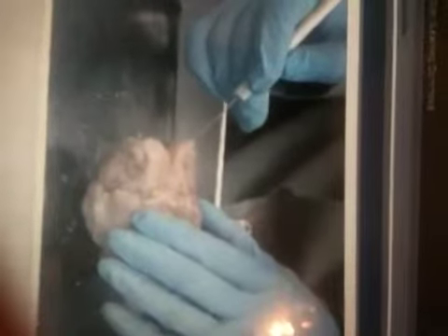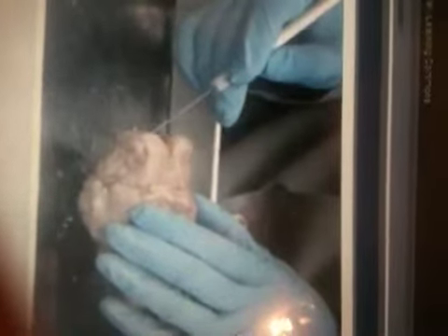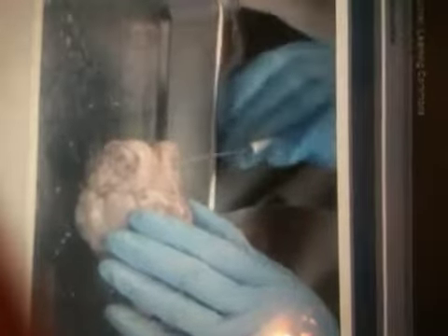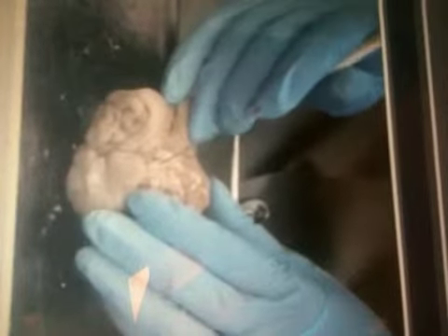underneath. First, we've got these olfactory bulbs at the anterior. You can continue to dissect those out if you wish with a scalpel or with your probe. Sometimes you can make your way along the edge and loosen it up. These olfactory bulbs sit on top of the cribriform plate of the ethmoid bone to pick up the sense of smell.